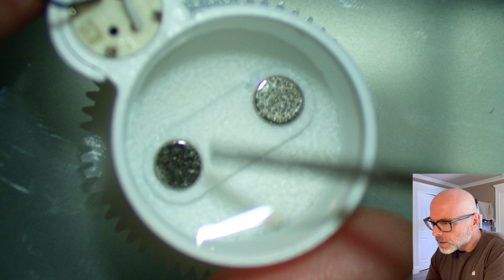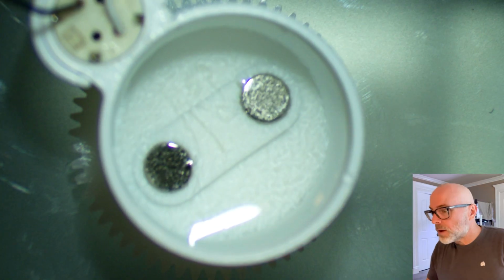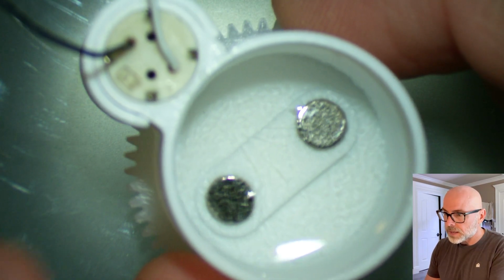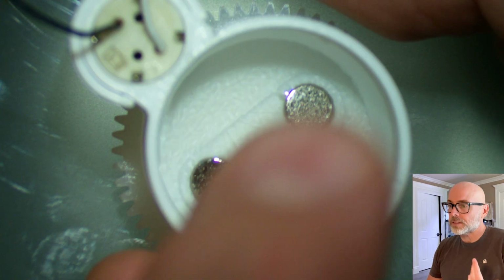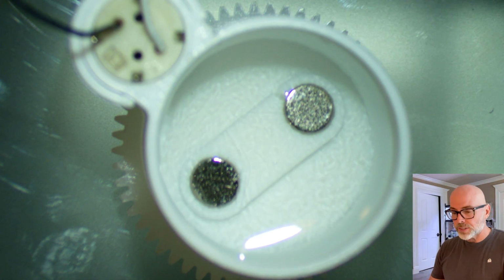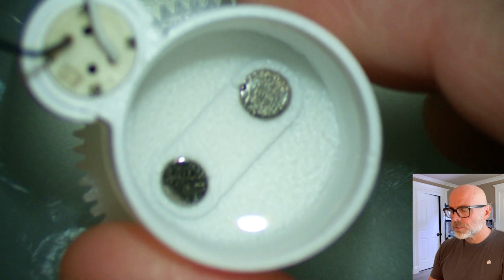I'll just move it around a little bit, and you can see the swirliness. That is, it's not well mixed. Now I'll turn on, so this is just a little motor. It has a little pinion and then a spur gear. The spur gear has two magnets on the bottom of it. Then there's a little mixing bar with magnets matching the magnets on the spur gear below. As we turn it on, here we go, it's starting to spin up.